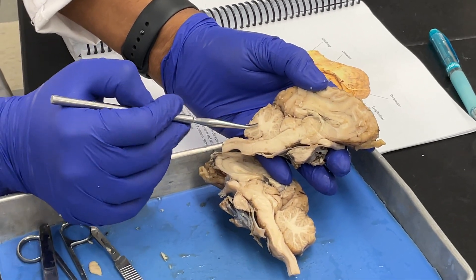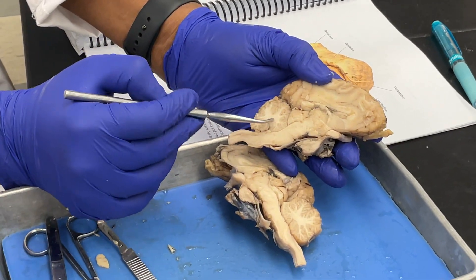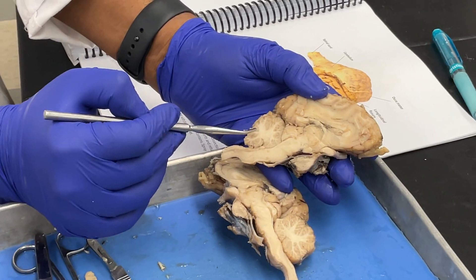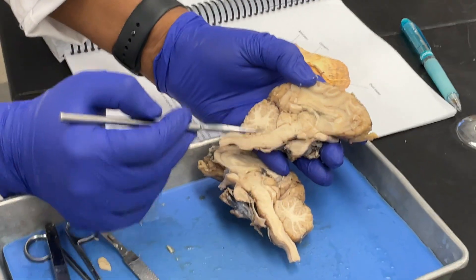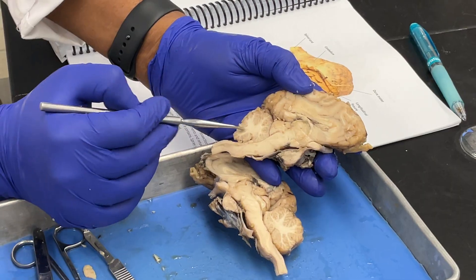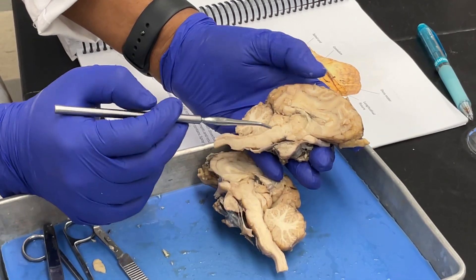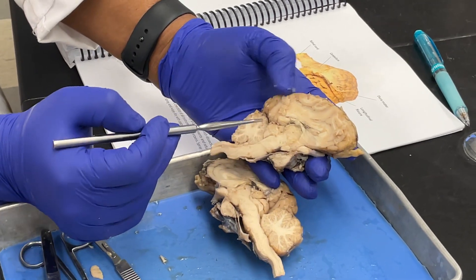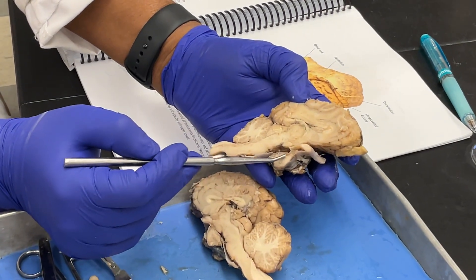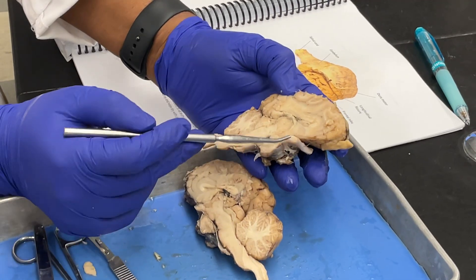Behind you have the cerebellum. The cerebellum has gray matter and white matter. The white matter here looks like a tree with branches, and it is called the arbor vitae. This is the white matter, and surrounding it is the gray matter.